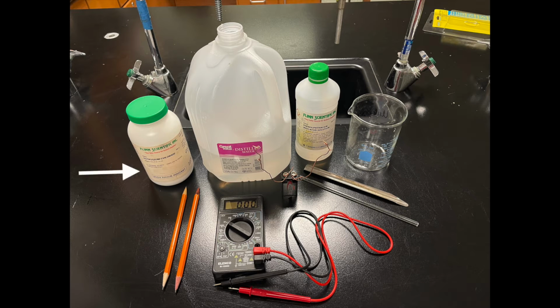As you can see, we have potassium chloride, which is our salt that will provide potassium and chloride ions, distilled water for the aqueous solution and to help dissolve the potassium chloride, the color indicator phenolphthalein, which turns clear in an acidic solution and pink in a basic solution, as you will see later, 2 pencils whose graphite will be used as the electrodes of the cell, a 9-volt battery which will provide the aforementioned direct current needed to drive the cell reactions, a stirring rod to help agitate the solution, a spatula for transferring the solid KCl into a beaker, and this beaker will of course hold the solution, and lastly we will be using a voltmeter for measuring electrical current as the reaction proceeds.